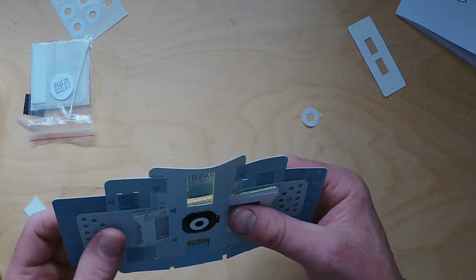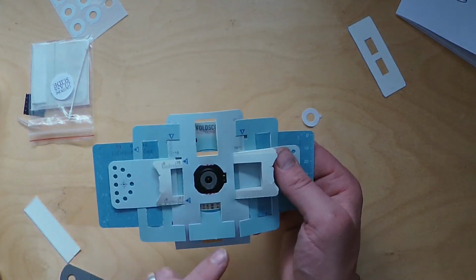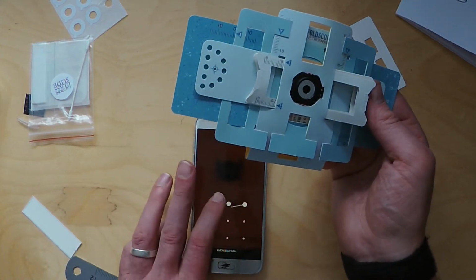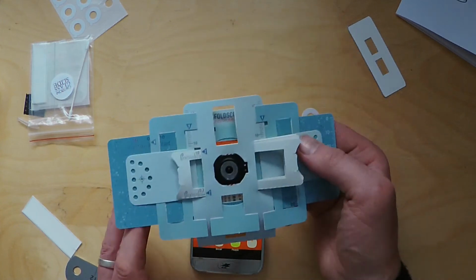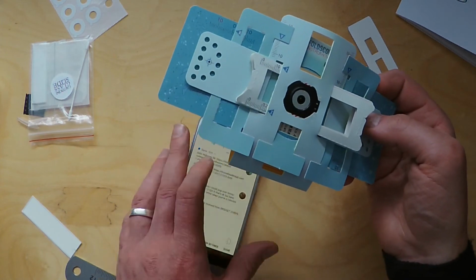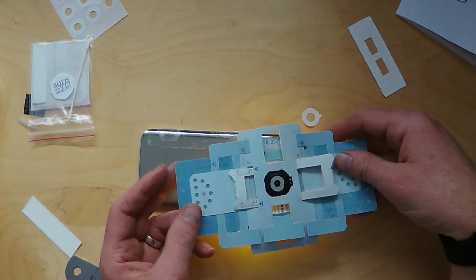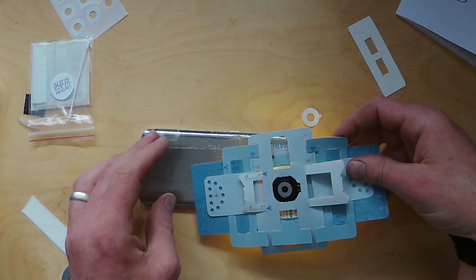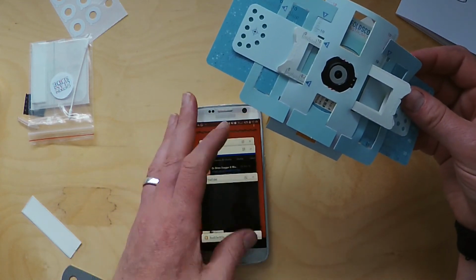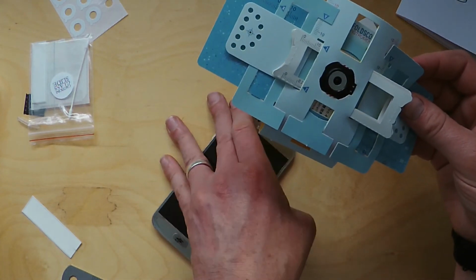So now you should be able to hold this up to the light, and you'll be able to see, when I put my phone in, the light of the phone. In fact, if I put my torch on, you can see the light through the lens there. So, oops, turn off. Okay.